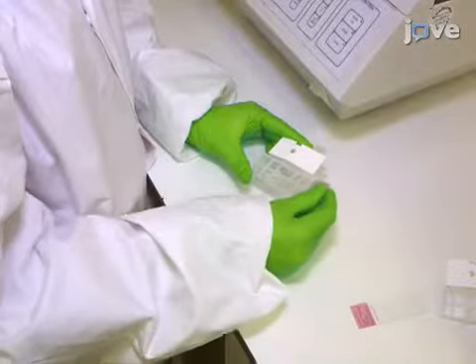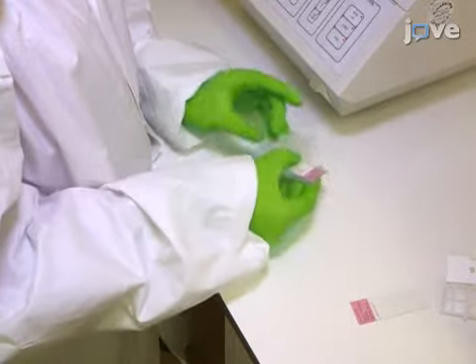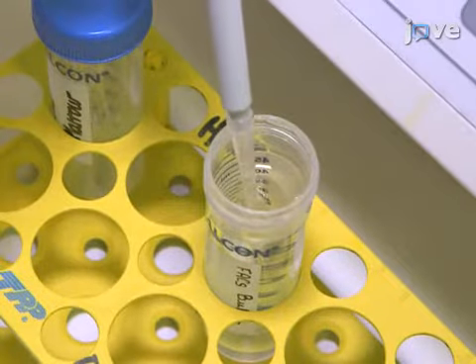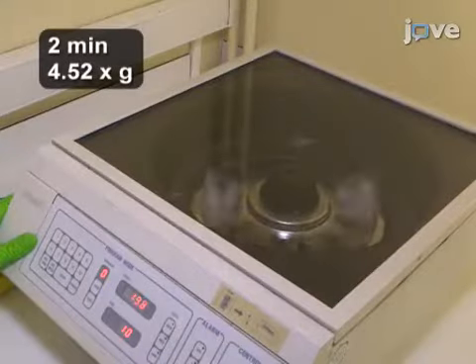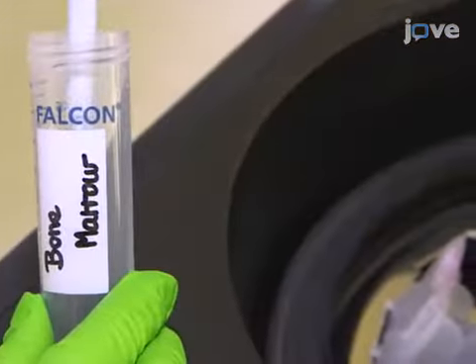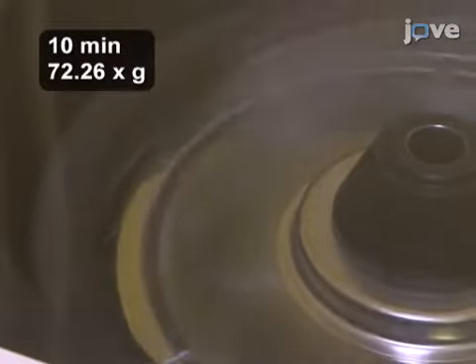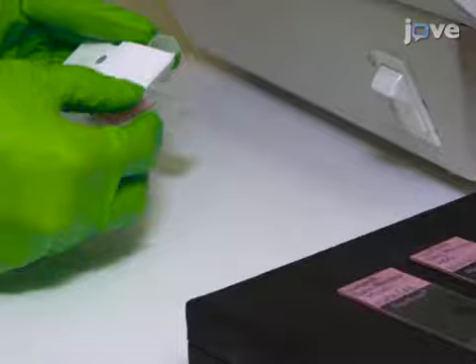To prepare the bone marrow cells for staining, first place slides into disposable chambers with pre-attached filter cards, and place the chambers into a cytocentrifuge. Add 100 microliters of FACS buffer to each filter card chamber, and briefly centrifuge the slides. At the end of the spin, add 100 microliters of cells to each chamber and centrifuge the cells. Then, carefully remove the slides from the chambers for air drying.